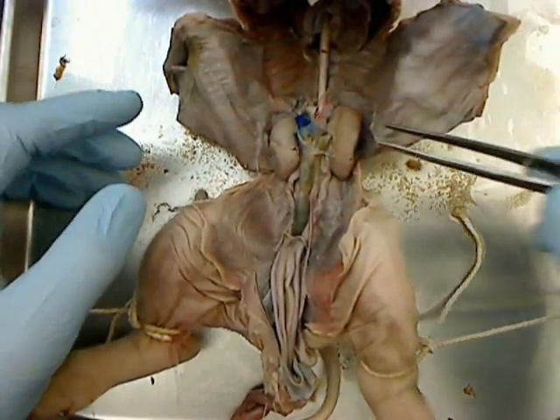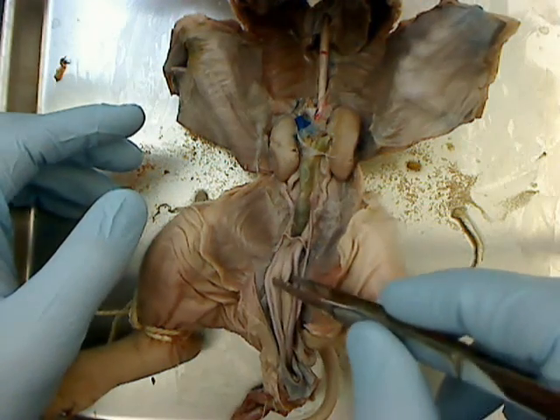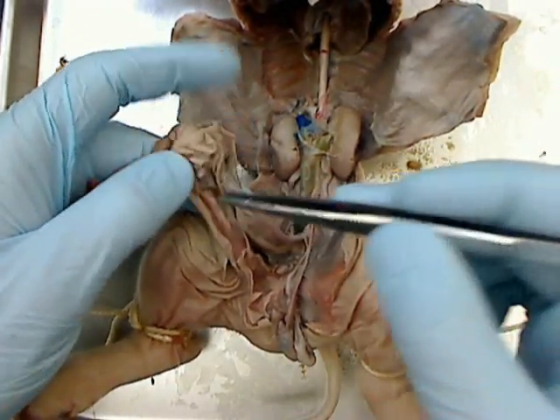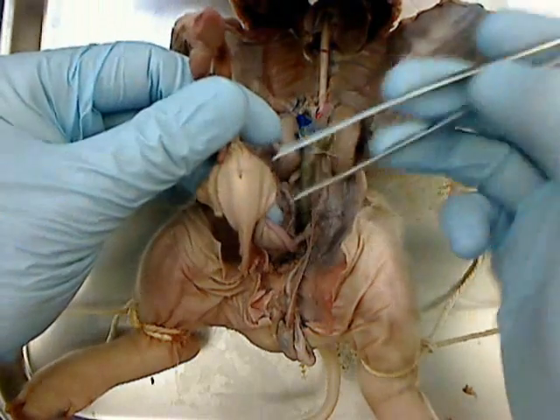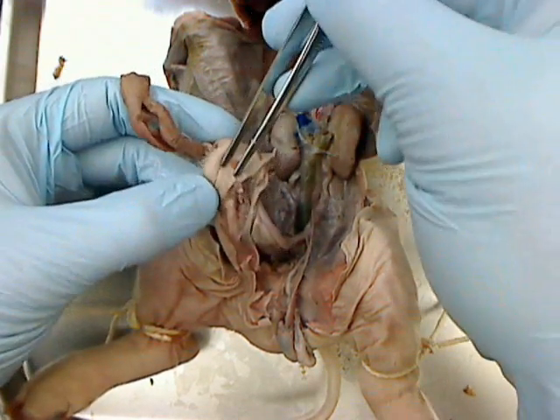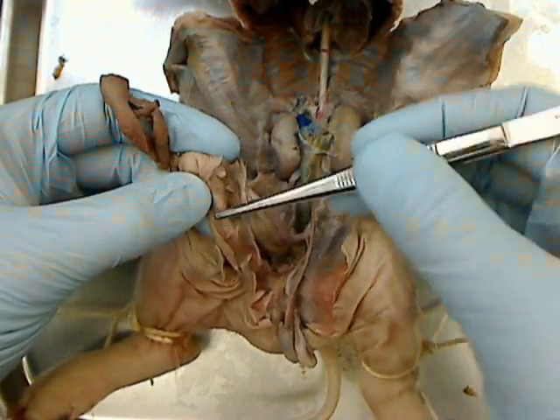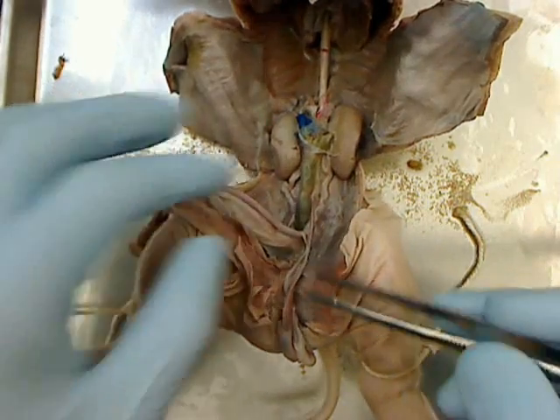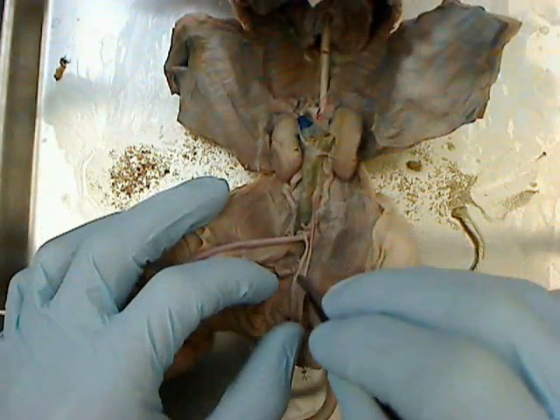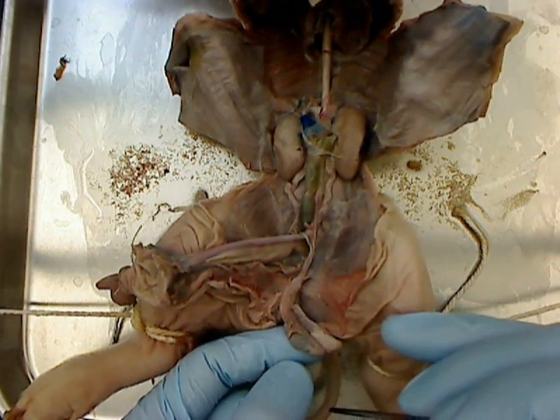To recap the anatomy for the urinary system: this is the left kidney, this is the right kidney, this is the left ureter, this is the right ureter, and this is the urinary bladder. For reproductive organs, the opening to the urethra — the urethral orifice — is part of both urinary and reproductive systems. The penis is under the skin here on the fetal pig. And then down here behind the bladder we have the vas deferens, or ductus deferens, and I can follow that all the way down to the epididymis and the testicle. And that's the male reproductive system in the fetal pig.